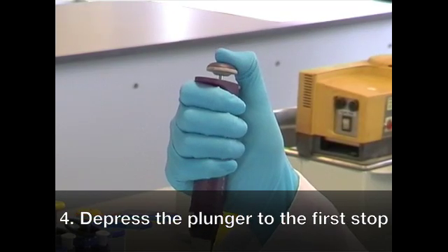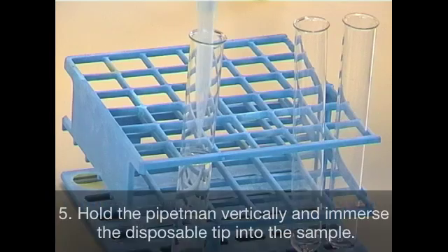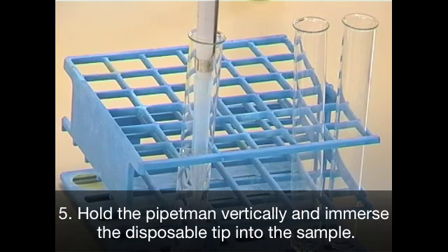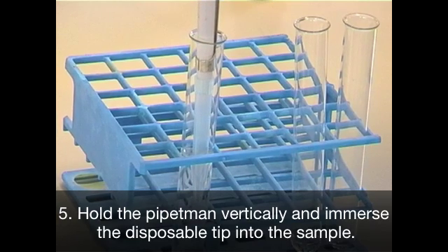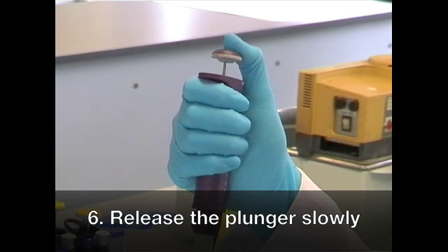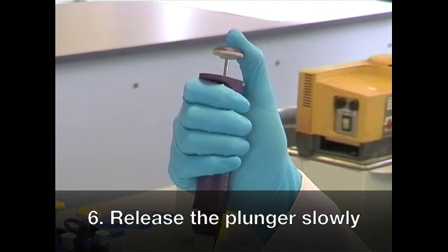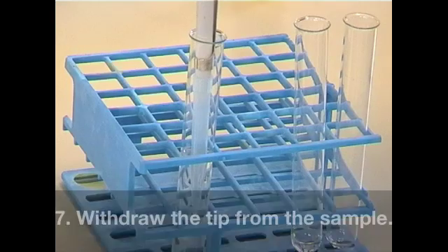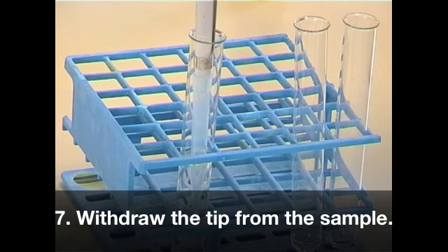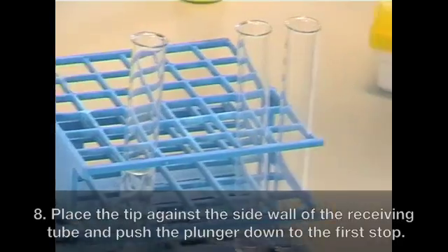Depress the plunger to the first point of resistance. Hold the pipetman vertically and immerse the disposable tip into the sample. Release the plunger button slowly to its original position. Wait a couple of seconds to ensure that the full volume of the sample is drawn into the tip, and then withdraw the tip from the sample.